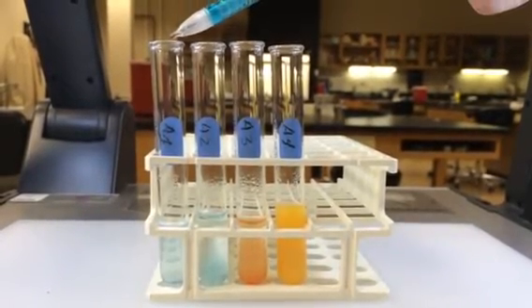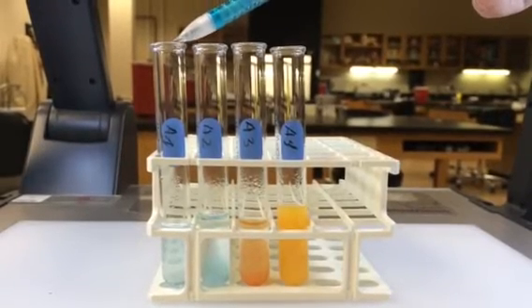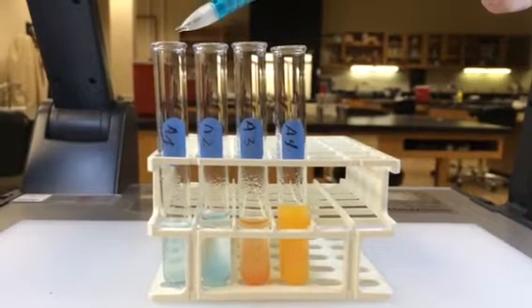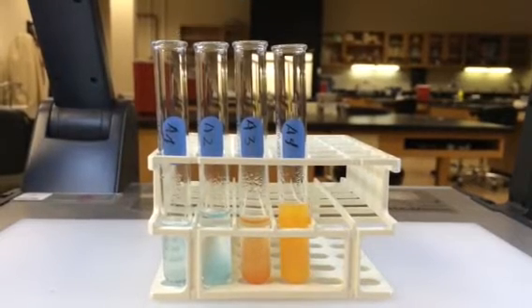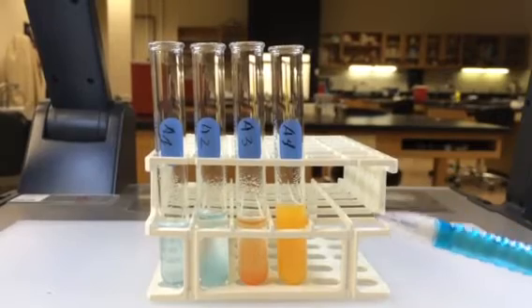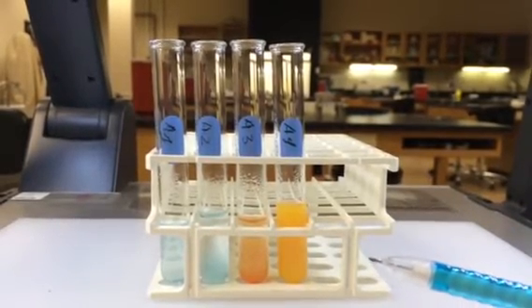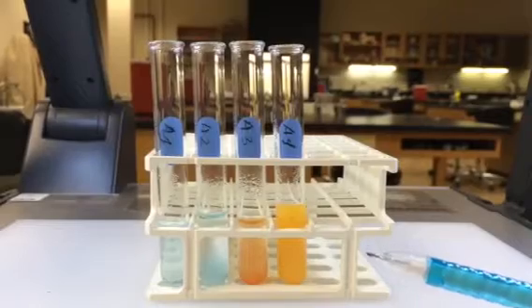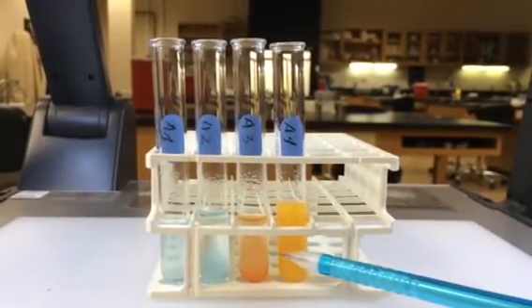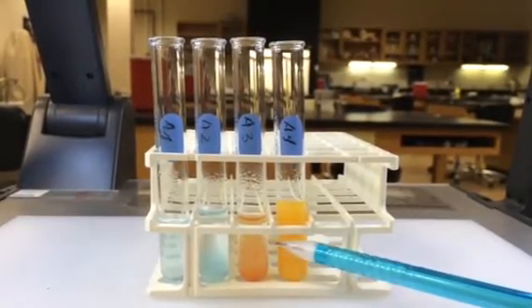In tube A1 we have amylase and water, so you would not expect there to be any maltose. The reagent we used to test for the presence of maltose is called Benedict's reagent, which turns the solution green or orange if maltose is present. So green or orange results are positive for maltose.